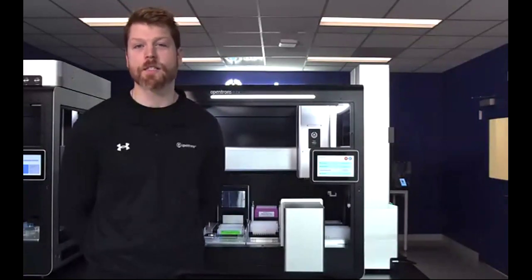Welcome to our live demo webinar focusing on how to automate 96 throughput NGS library prep with the OpenTrons Flex high throughput NGS workstation. My name is Nick Ritzo. I'm a product manager for hardware and BD OEM here at OpenTrons, and I'll be joined today by my colleague Matt Akana, a senior NGS scientist at OpenTrons.